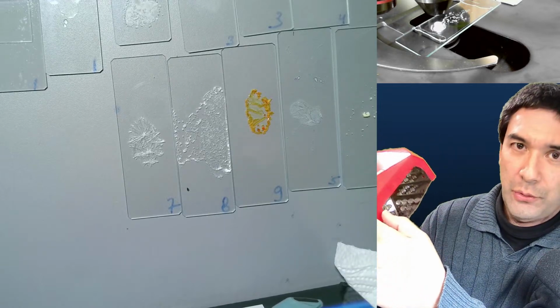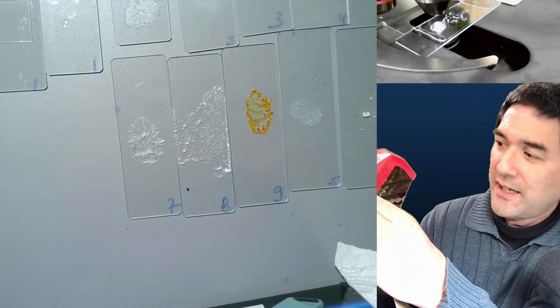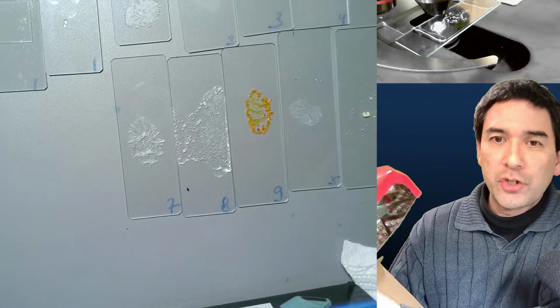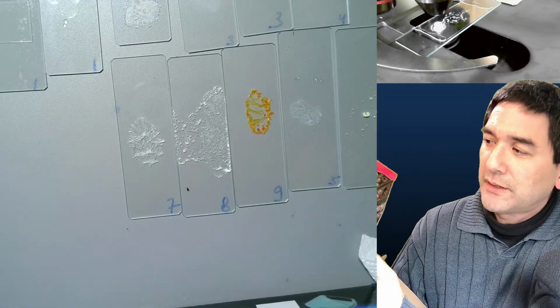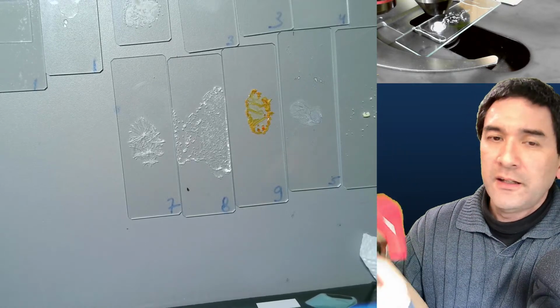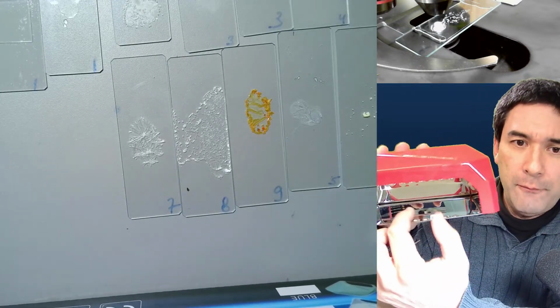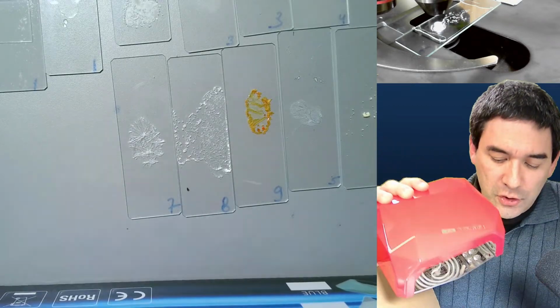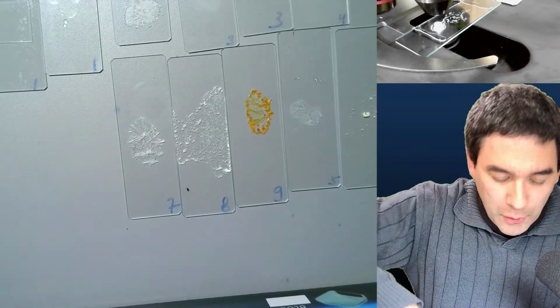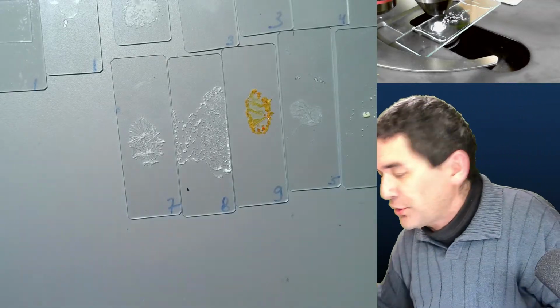Honestly, I don't have a good feeling putting ultraviolet light on the skin, but apparently this is tested and apparently it's safe, I was told. Obviously, otherwise it wouldn't be allowed, right? So this actually shows that not all ultraviolet light is the same, right? Of course, I wouldn't look into the whole thing too much, but this is specifically designed to be used for fingernails. I have also used this already before. I put my microscope slides in here. I just wanted to show you that this is indeed possible. Again, I'm not saying it's a good or a bad solution. I just want to present it to you as a possible option.